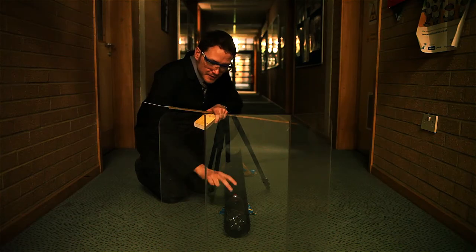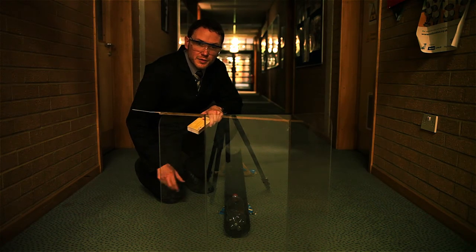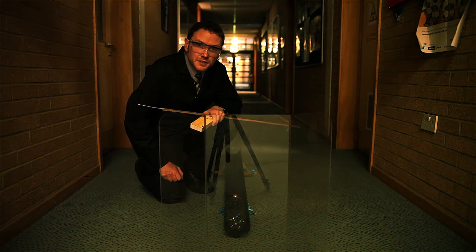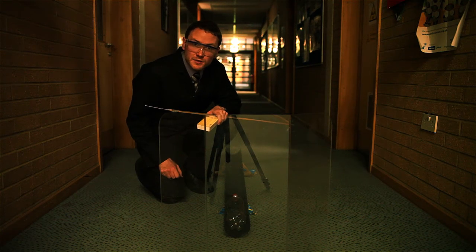When ready to go, leave the bottle at the bottom of the ramp, protect audience and demonstrator with a safety screen, and light with the end of the splint.